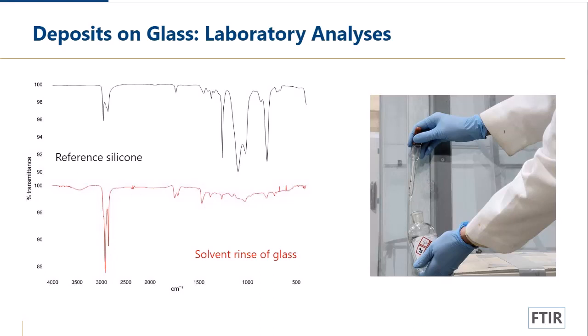But the important thing is if you look at the bottom spectrum in red, that's the solvent rinse of the glass. And if you compare it to the top spectrum in black, that's a reference silicone oil. And we don't see evidence of silicone oil in that solvent rinse. So we can stop worrying about any bleed out from that sealant.